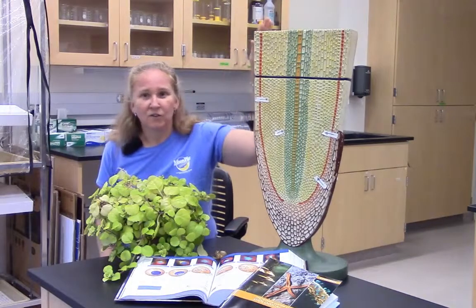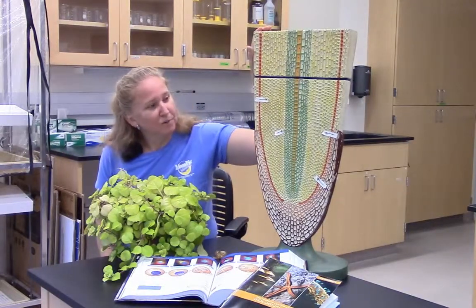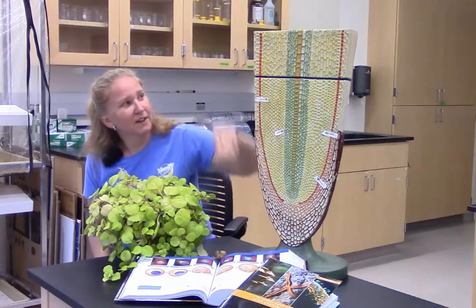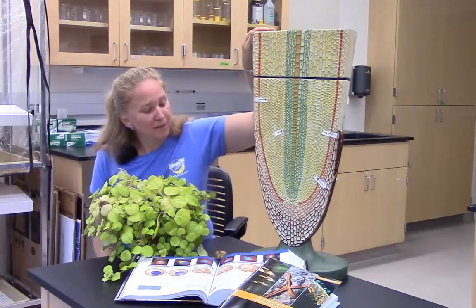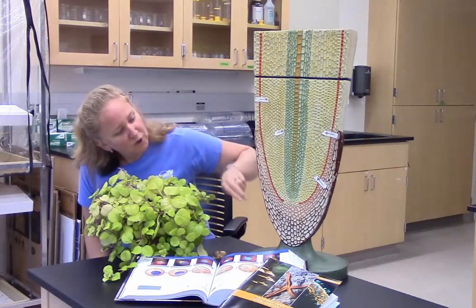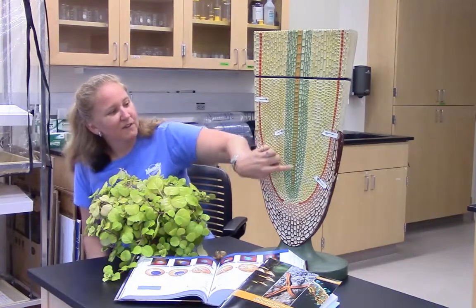Let me draw your attention to the model that I have here to my left, to your right. This model represents an onion root tip. Here's the bottommost part of the root, and here's the part that would be closer to the onion bulb. As the onion begins to grow a root, that root has to push down into the soil. So there's a protective tip of dead cells down at the bottom, but within the zone of cell division you'll see that there's a lot of cell division going on. You're going to spend some time in lab looking in this region of tiny thin sections of onion root tips in order to find cells in the different phases of cell division.